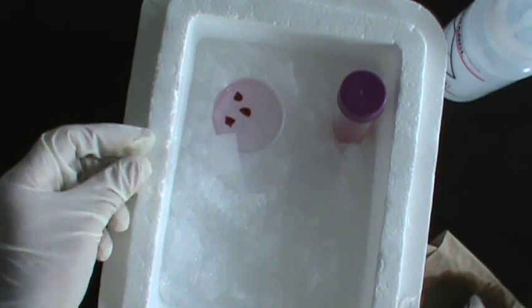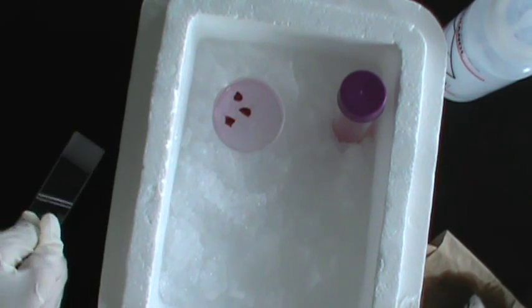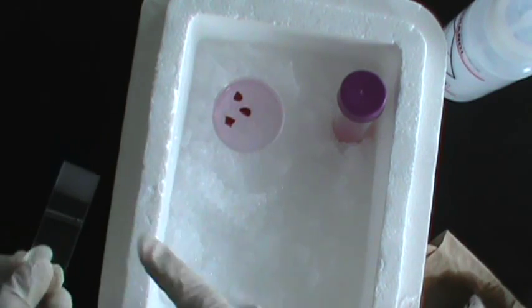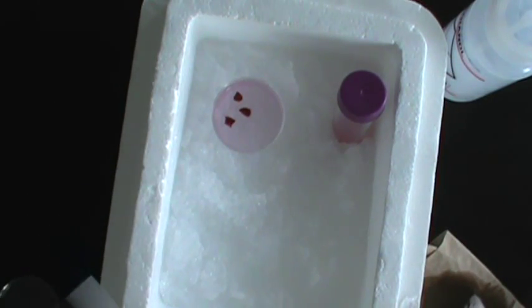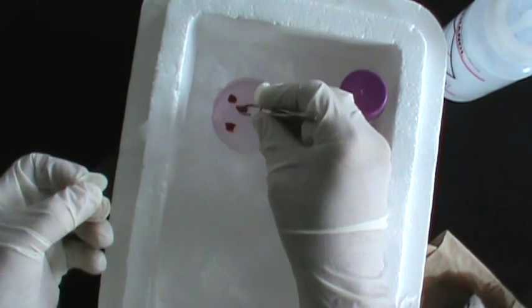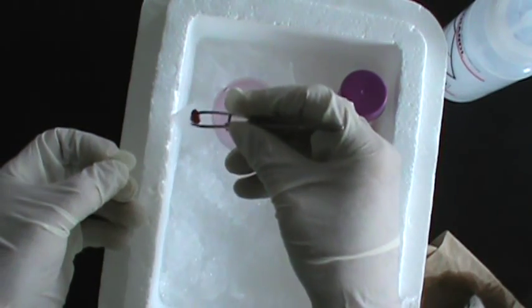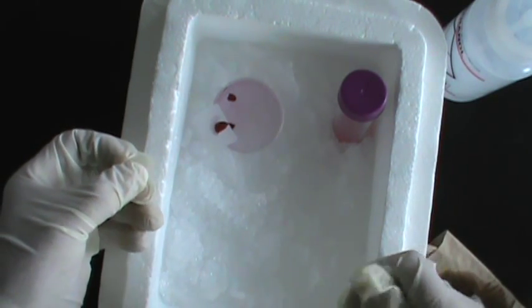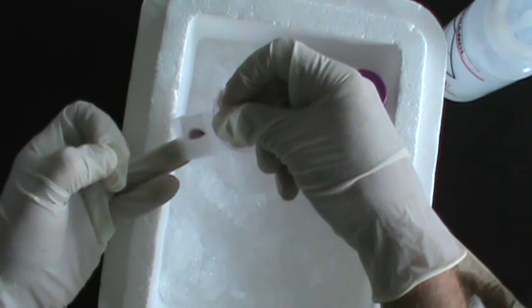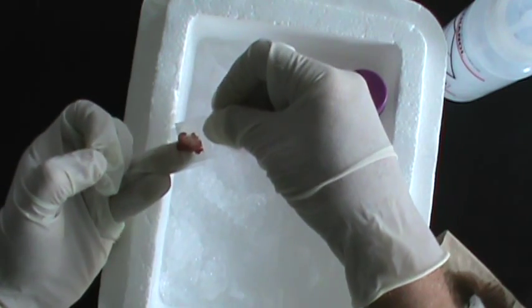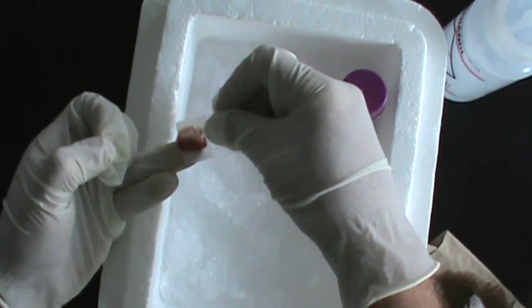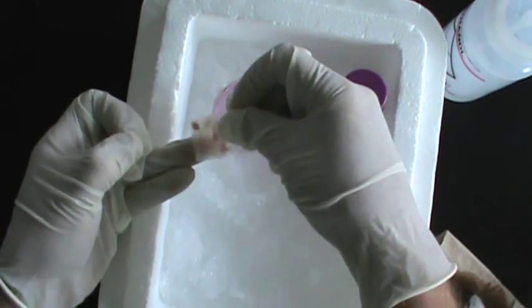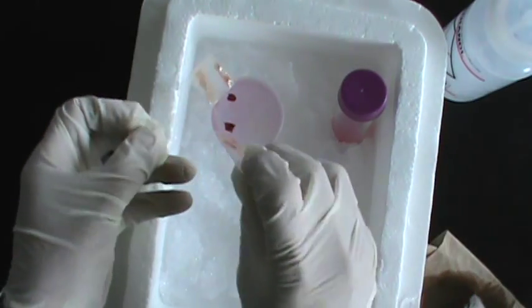We're going to be using what are called frosted microscope slides, where at one end they have a little bit of frosting. That creates a rough surface. So what you do is take a piece of spleen, put it on the rough surface of one microscope slide, take a second microscope slide, and smash the spleen between the two rough surfaces. What this does is disrupts the spleen cells.